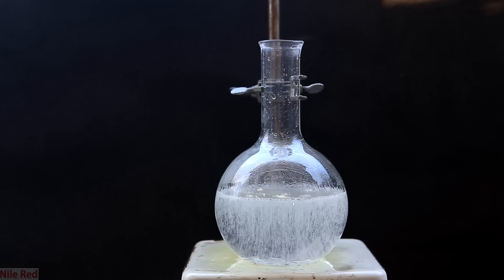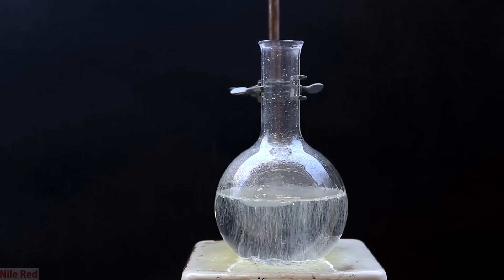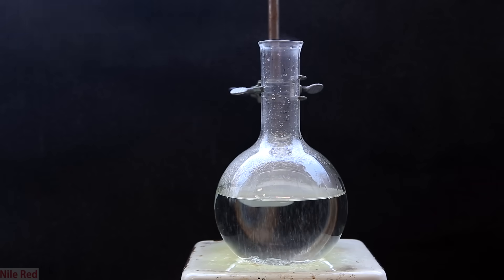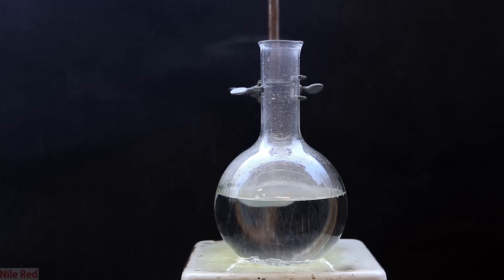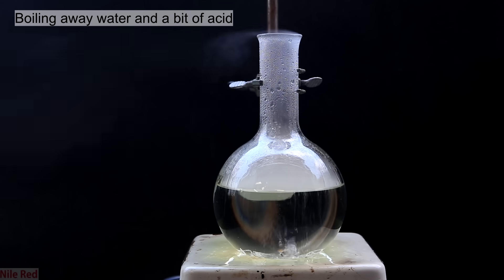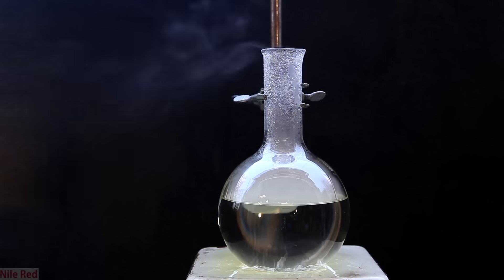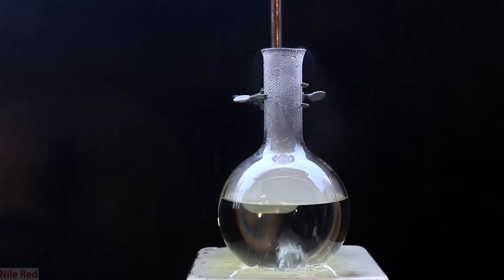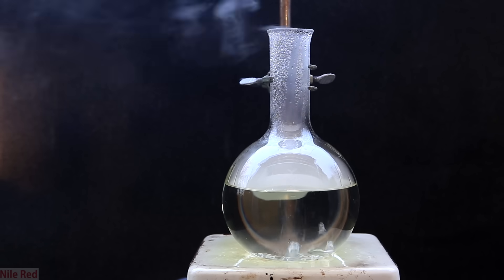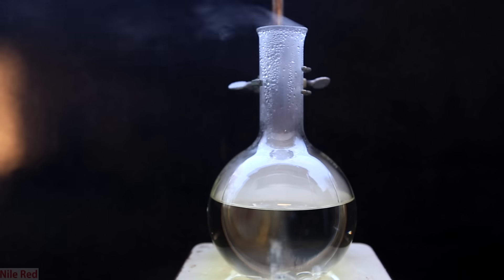As the temperature starts to rise, a lot of bubbles come out of solution. These bubbles are both CO2 being liberated as the solution heats up, and oxygen as the excess peroxide breaks down. The bubbling will slowly die down and become more constant. What we're boiling away at this point is mostly just water, and the acid should be slowly getting more concentrated. Eventually I reached a point where bubbling wasn't as constant, and I started to get big bursts of larger bubbles. Crazy bumping can start to occur because now we have sulfuric acid at around 300°C but there's still water there, and it's basically getting superheated.